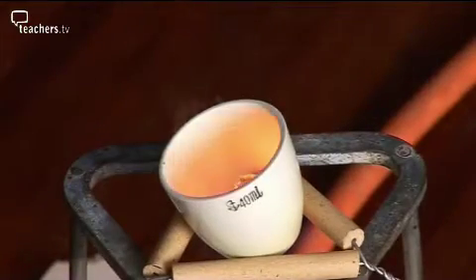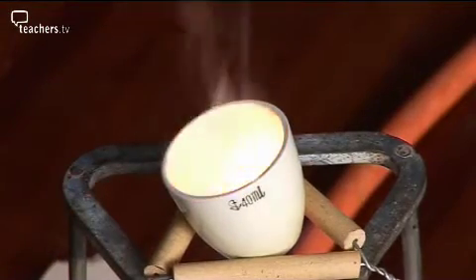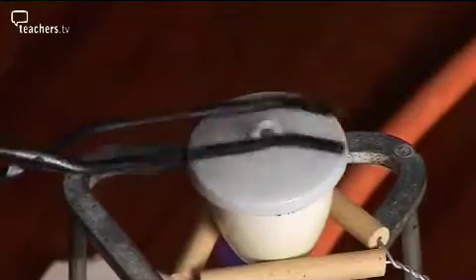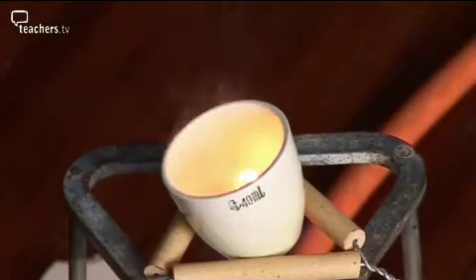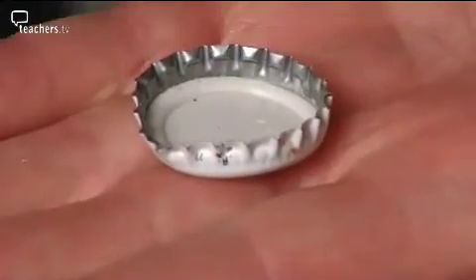If you lift the lid for too long a time, magnesium oxide comes out, and that spoils the results in the end. So if they can't lift the lid off the crucible, but they need to in order to see whether it's stopped burning brightly, how can they resolve that issue? Well, we have got an alternative method which I can show you, involving beer bottle tops.